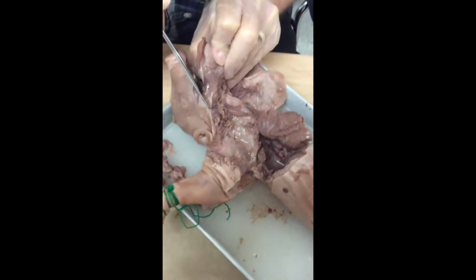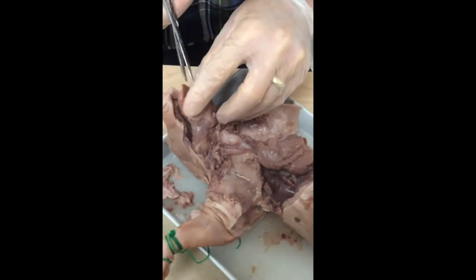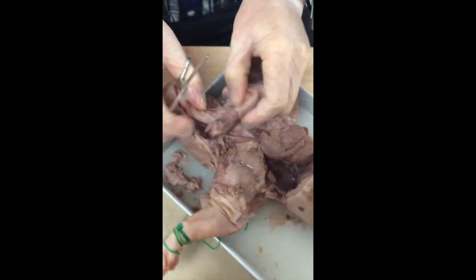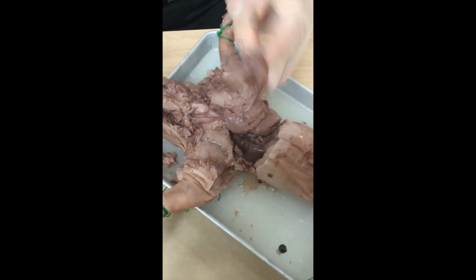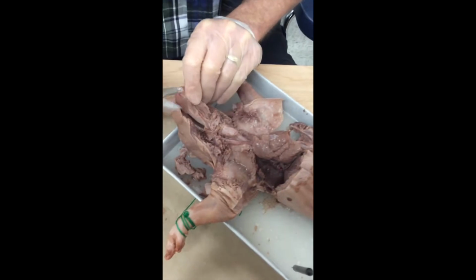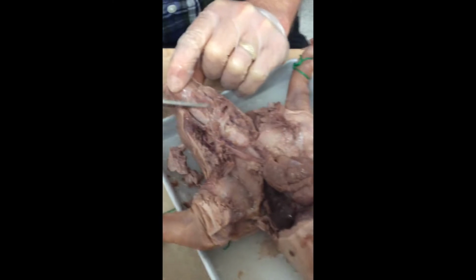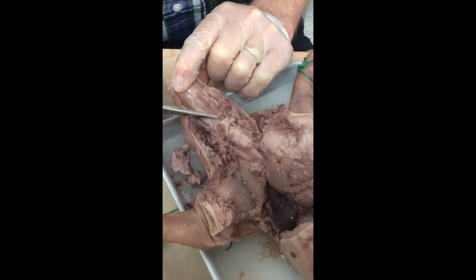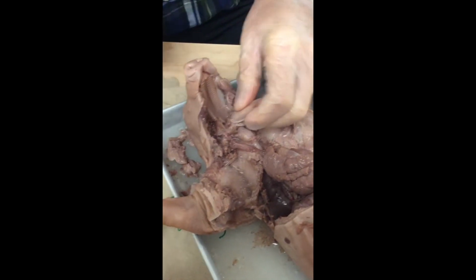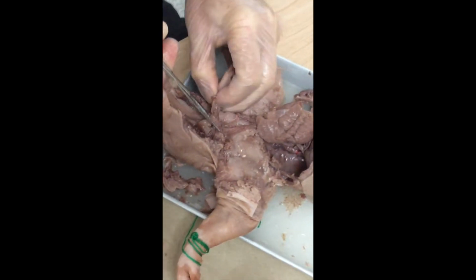So I'm taking off the jaw. This is pretty morbid, I know. I'm going to dismember the tongue, cutting the ligament on the lower aspect of the tongue, teasing that out, and I've got the jaw out of there. So that's the mandible. It's now out of there. And because I've done that, you can see that the tongue does have muscle. The tongue is a muscle itself. It comes down here and attaches to that hyoid bone. Now I'm going to go on the other side here, and I'm going to be trying to get this all out intact.